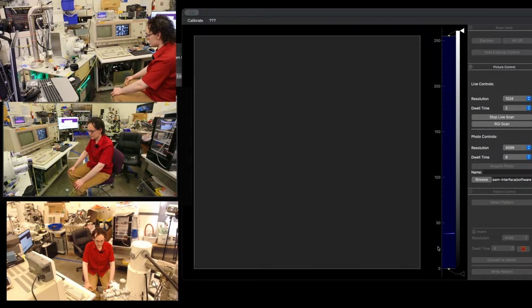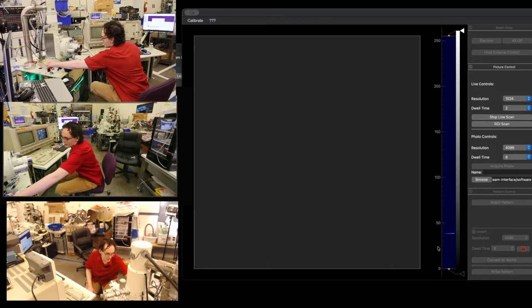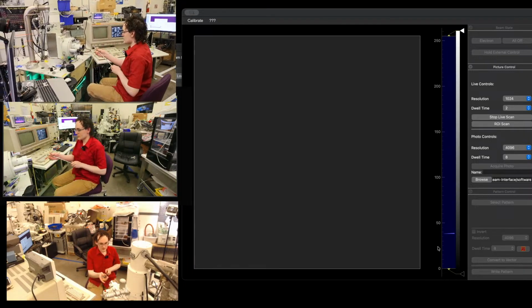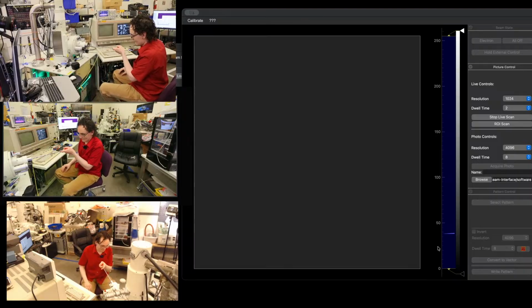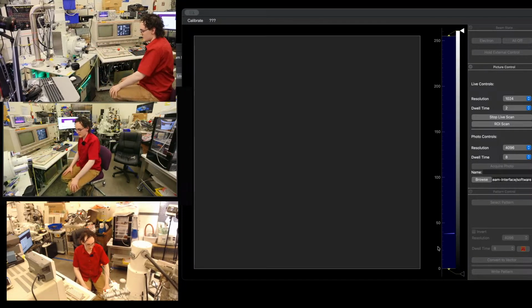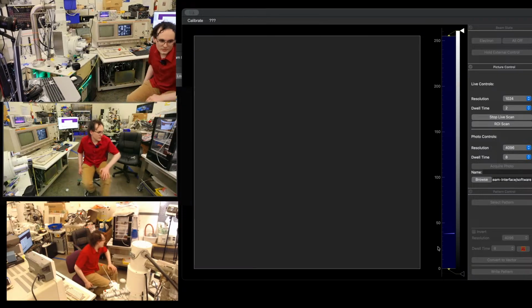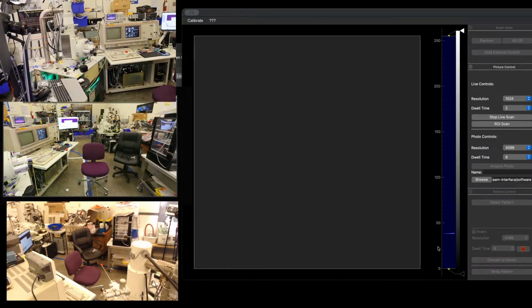Again? It's a gate valve, maybe. Could have a leak on the load lock. Yeah. So if it's a load lock leak, pumping the load lock down will take care of it. I'm gonna grab a multimeter and see what's going on with that. There's one on the bench.